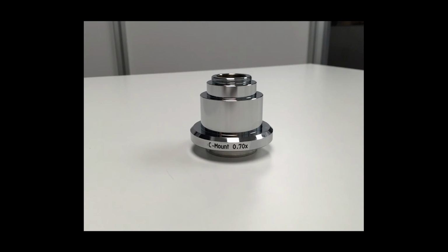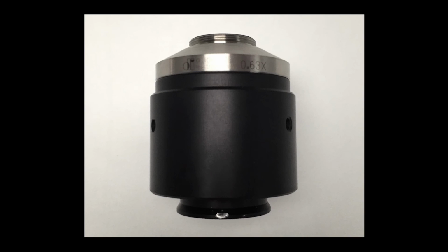A good camera coupler is usually relatively expensive, and it should be handled with care. You should take care not to over-tighten the set screw. Tightening the set screw too much might make a dent into the coupler, making future camera alignment more difficult.